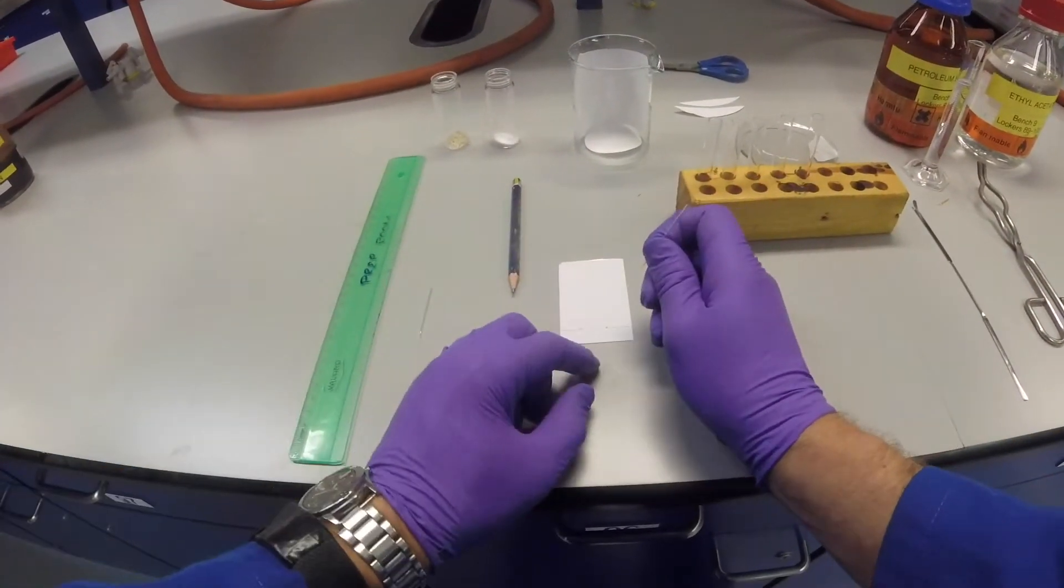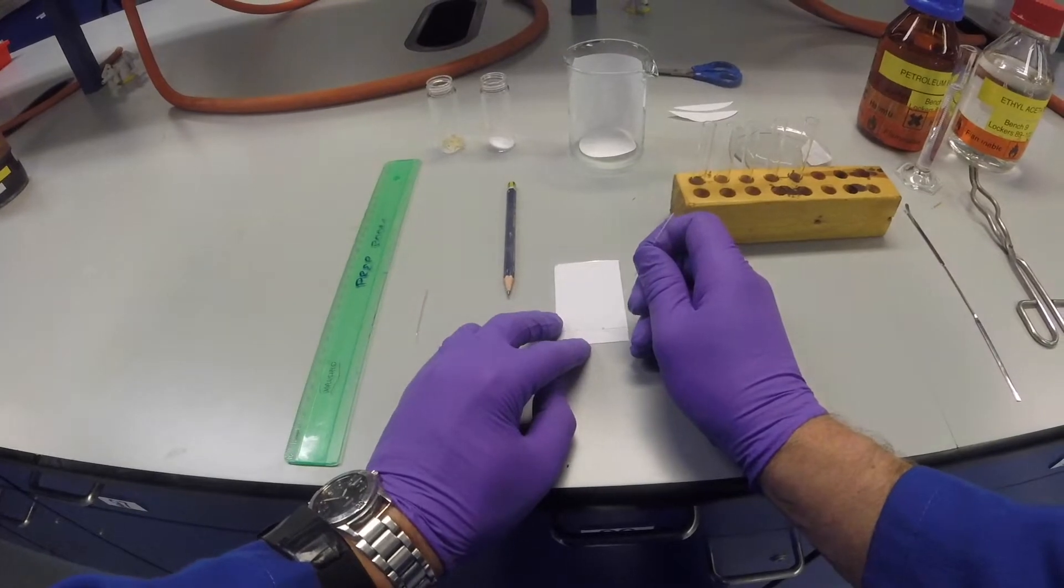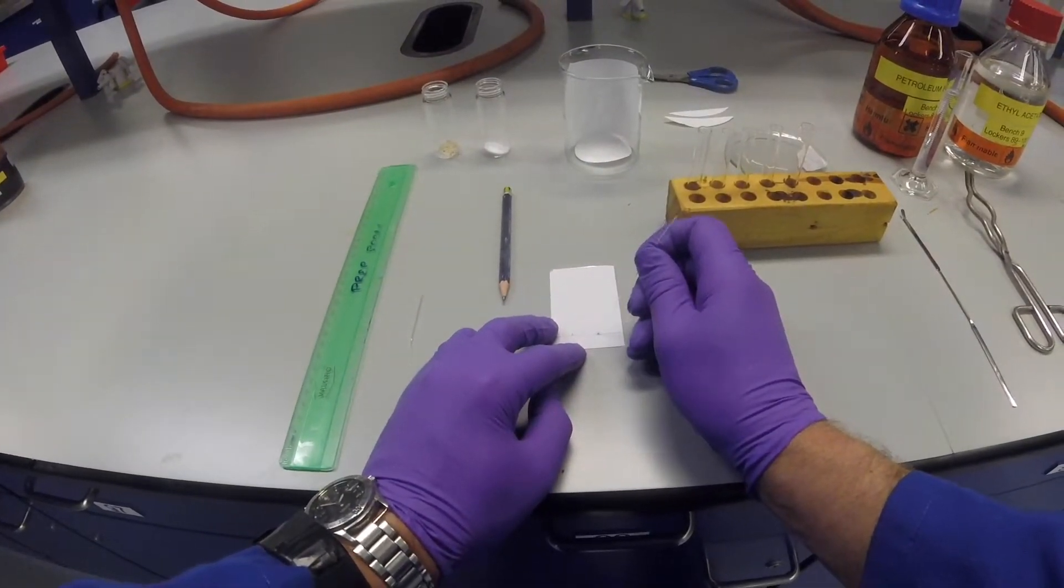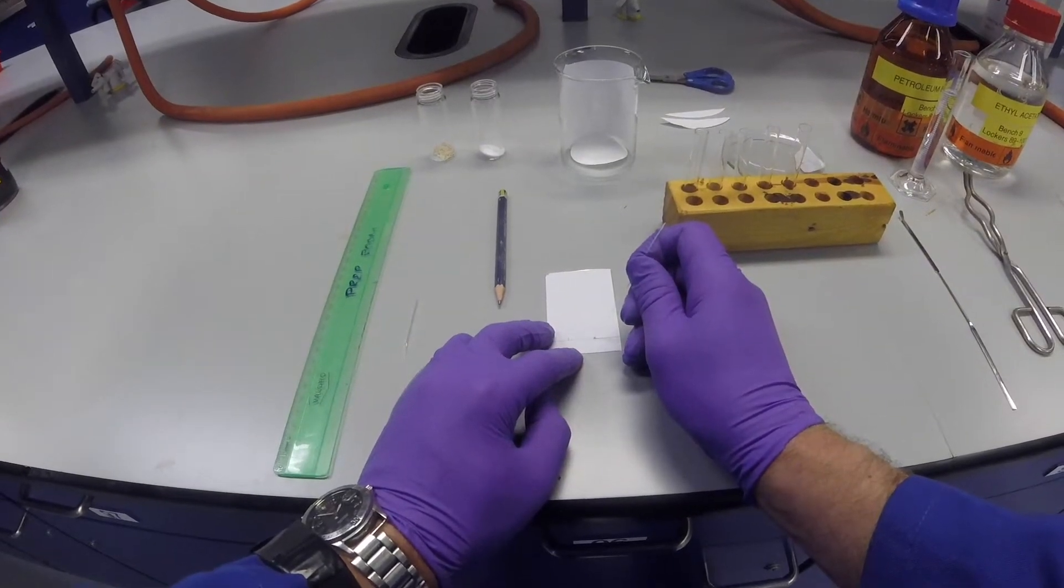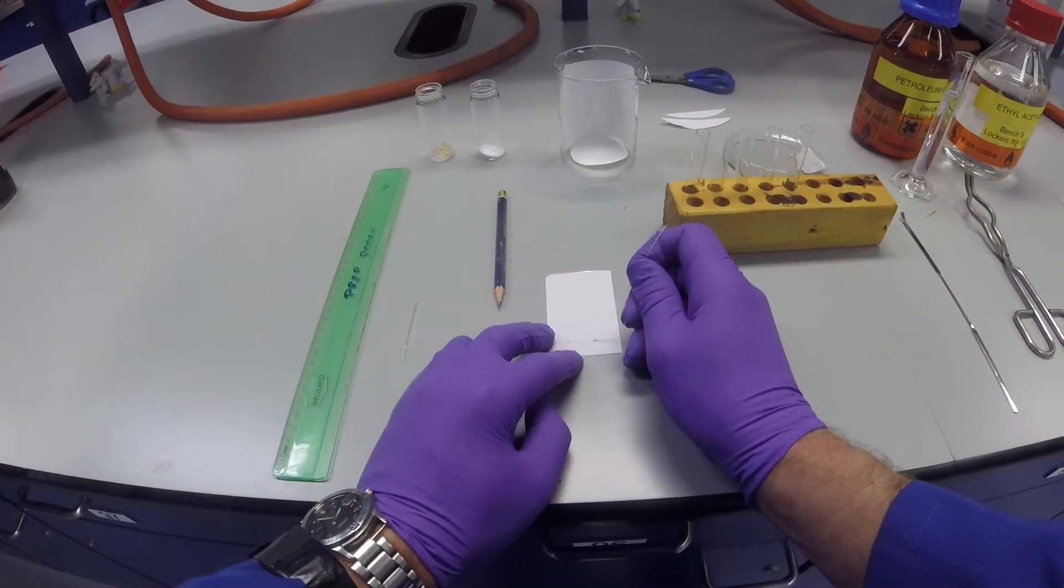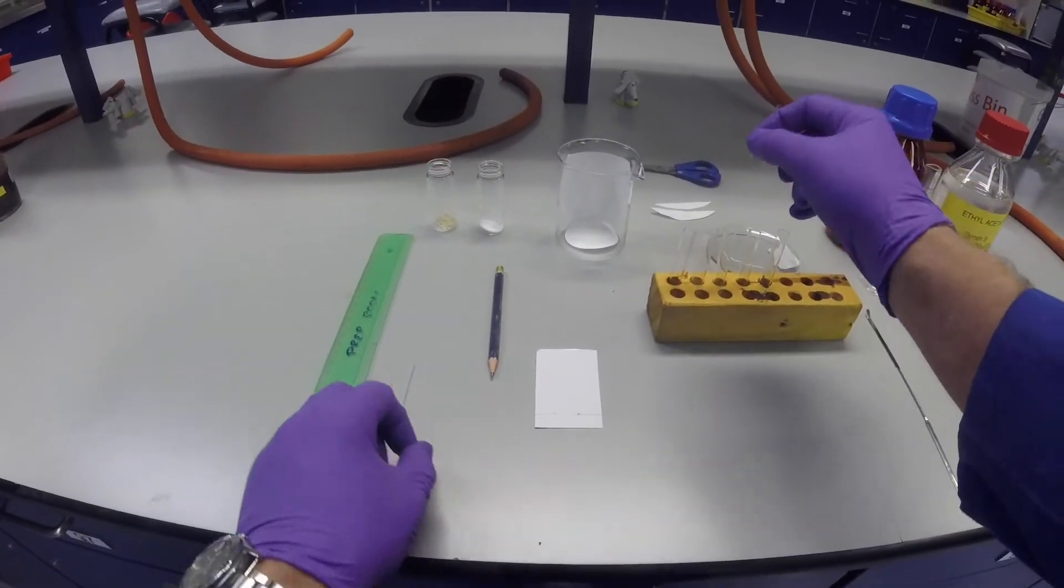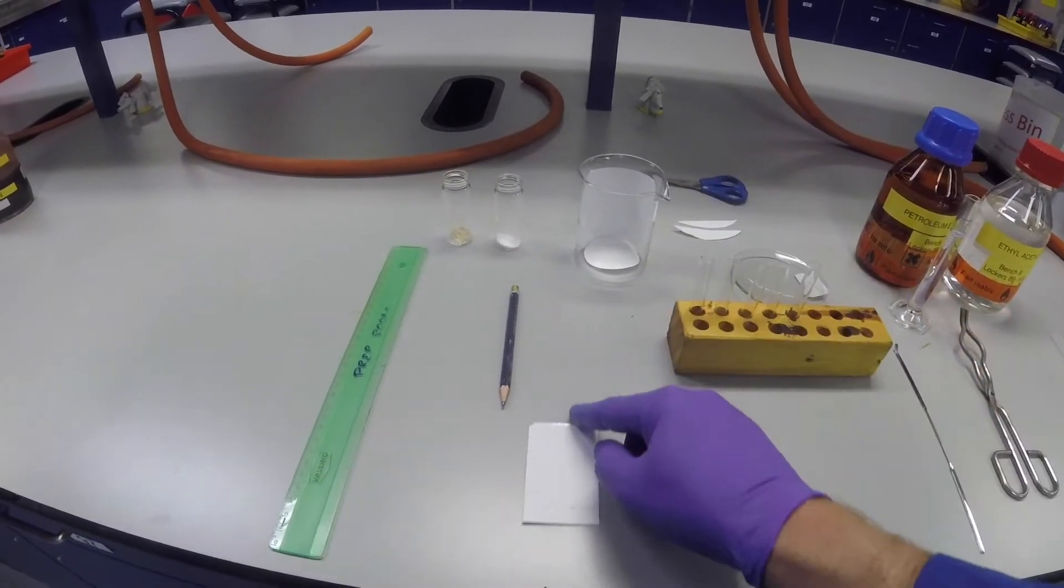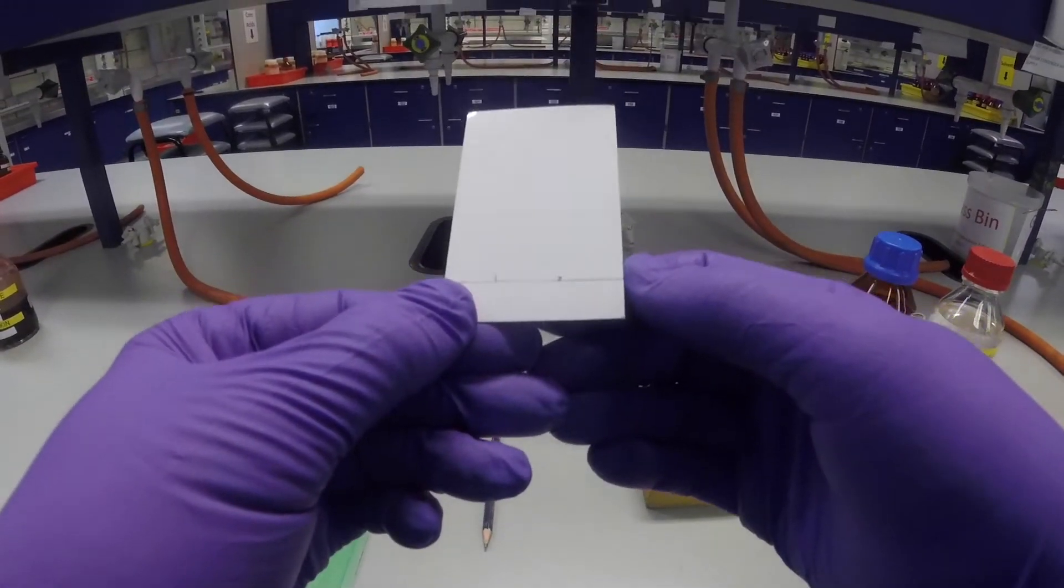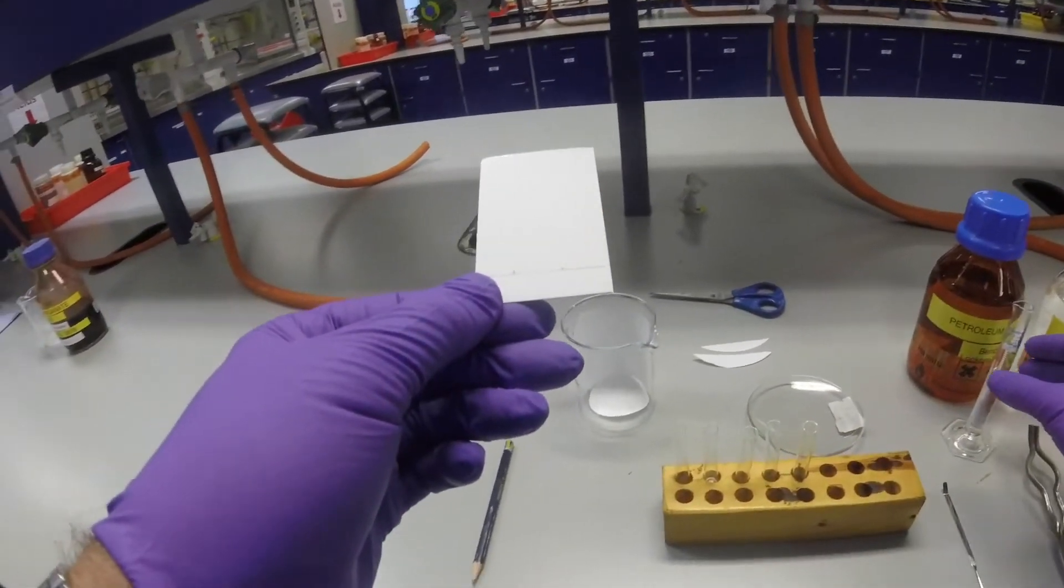Again, we're going to take our compound, very gently touch it. You can hopefully see the spot developing. So now we've spotted our two compounds onto the plate. We can't exactly see where they are at the moment.